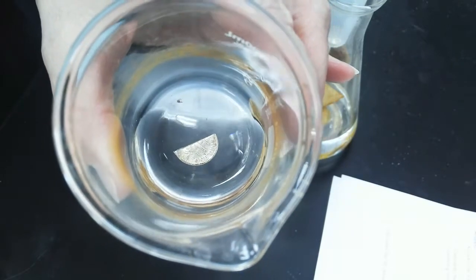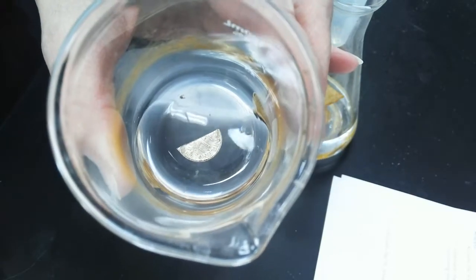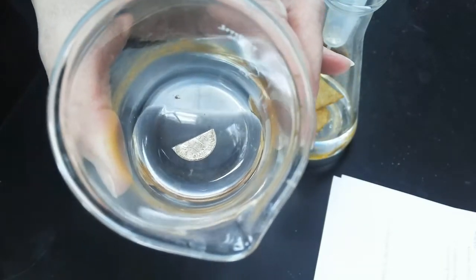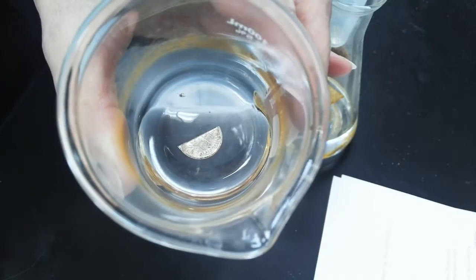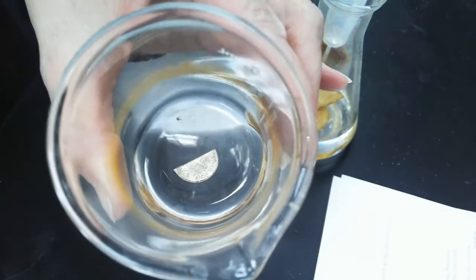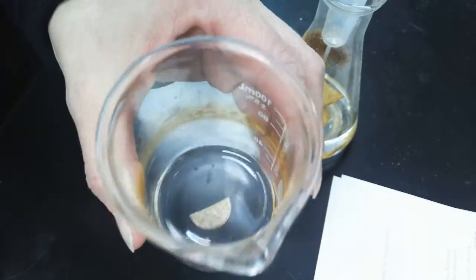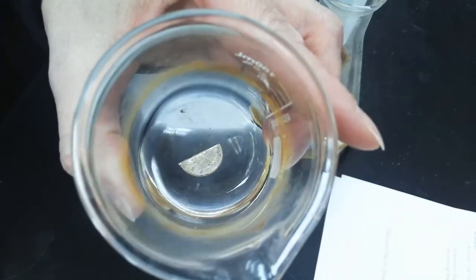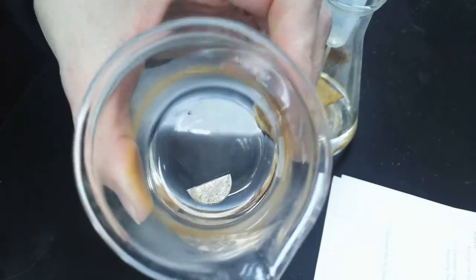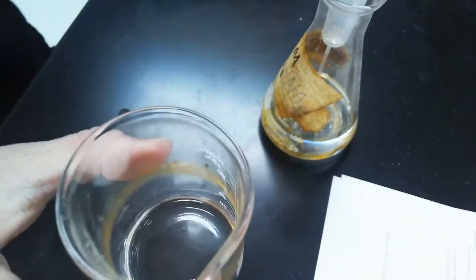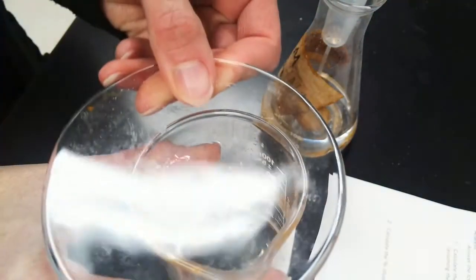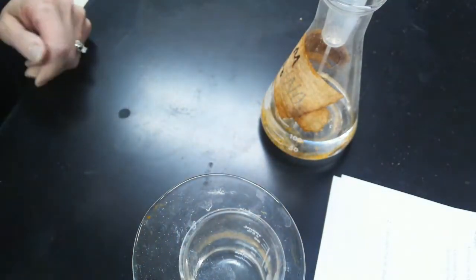And it gives off a toxic gas. So when I see like this kind of toxic brown gas being released, then we know that it's time to get it in the fume hood. But it takes, I don't know, maybe like 20 minutes or so to see too much of a change. So for now we've got the dime in the acid. I'll cover it with a watch glass. Move it over to the fume hood.